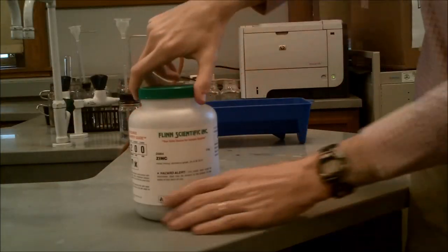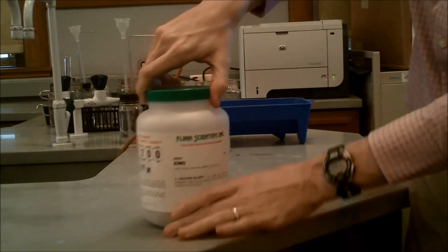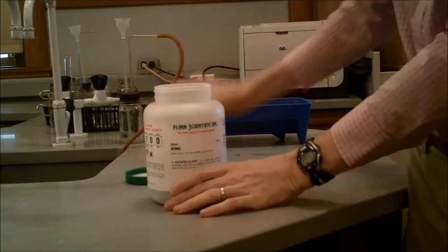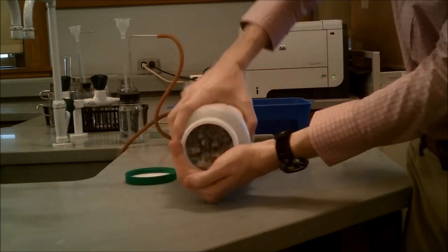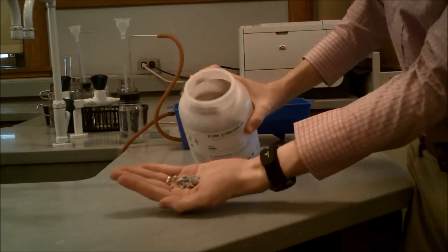This is the zinc. This zinc will go in the bottom of the reaction chamber, the cylindrical glass tube.